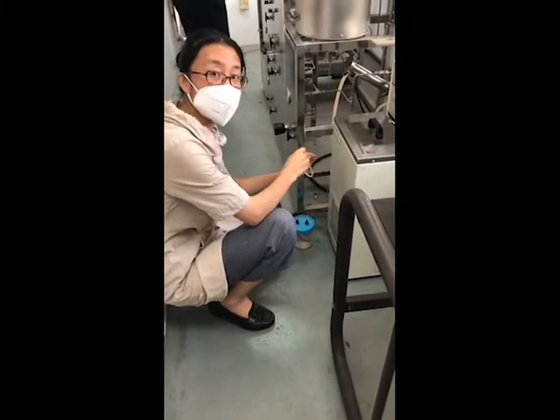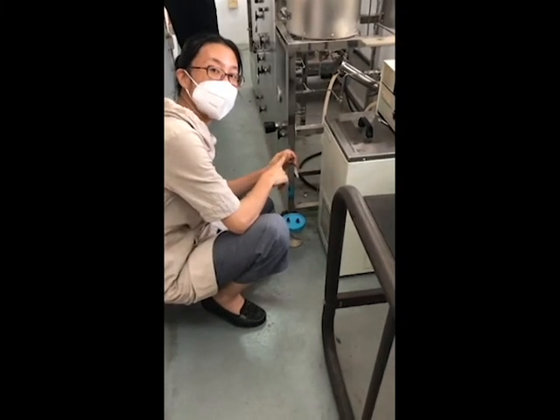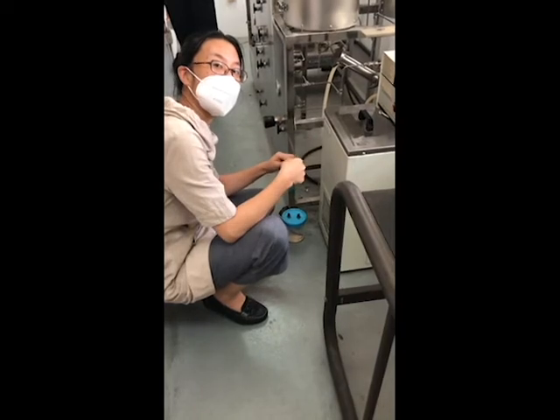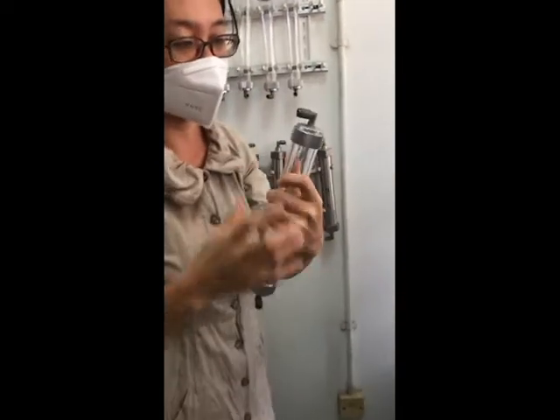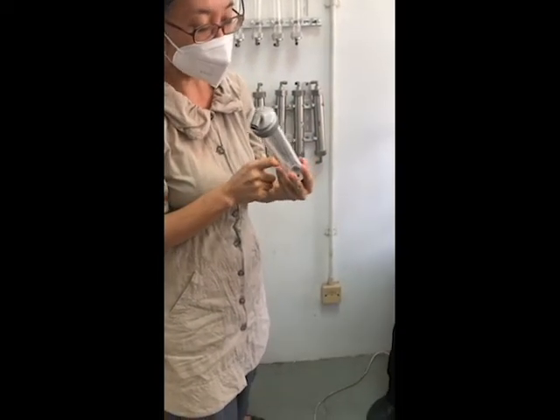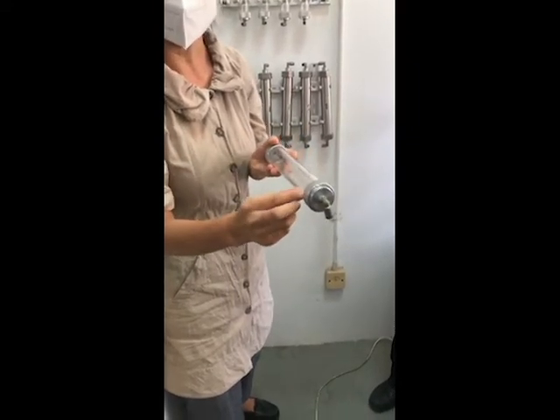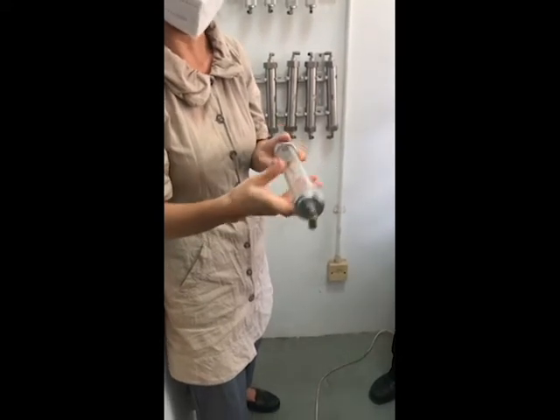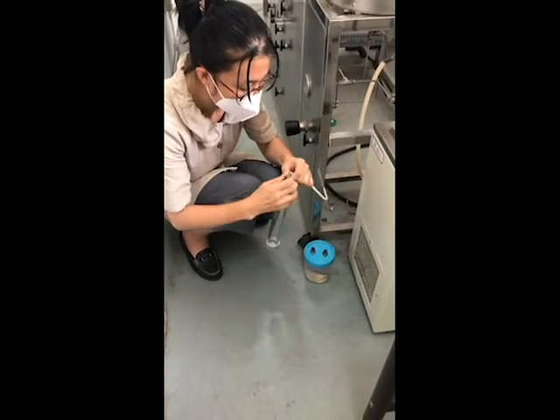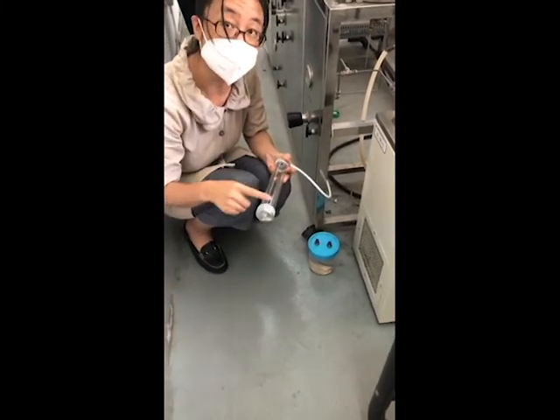So if necessary, you need to remove the humidity. You can connect some purification process after this, like using 4A molecular sieve to absorb the water. You can take this out and fill in the 4A molecular sieve inside here. Put some cotton at the hole. Add silica gel, the blue color silica gel, as an indicator. Connect to the sample port here with this one. Then you collect your gas from here, and the humidity is removed when it passes through.